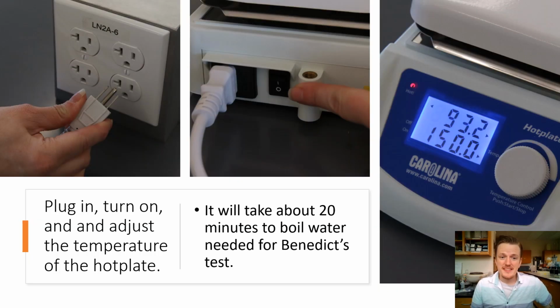Yeah, you have to plug things in for them to work. So make sure in the future you do that. And yeah, this is about time management. It'll take in the experiment about 20 minutes for the water to get up to temperature, and then you have to be careful that it's hot, of course.